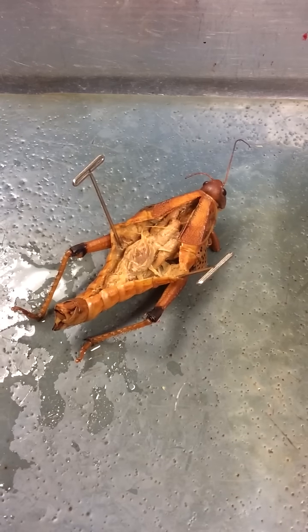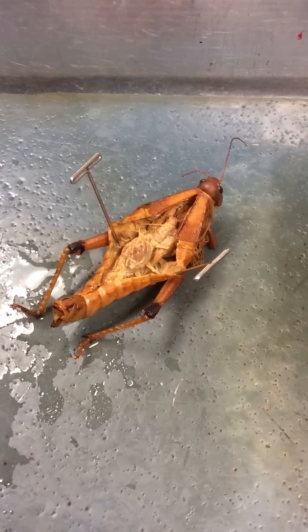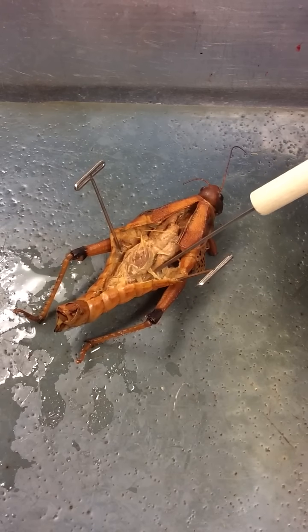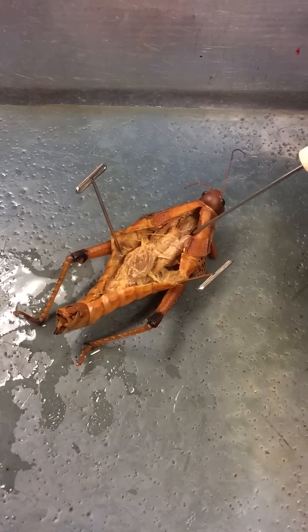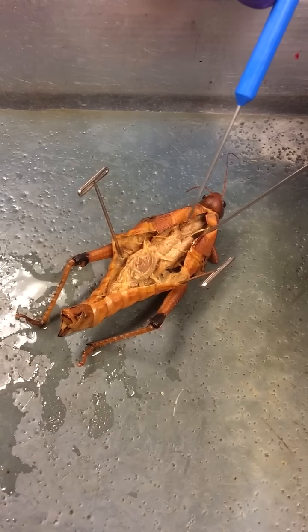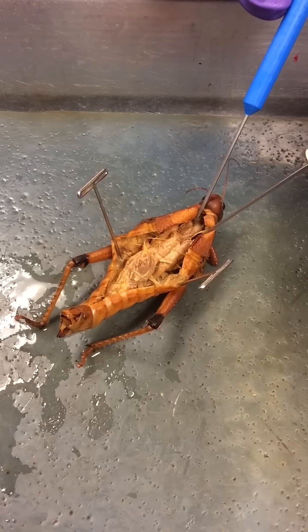Here we are with Bio 182 doing a dissection of a grasshopper. This is order Orthoptera. We'll start with internal anatomy. Here we have the trachea. If we work ourselves medially, we'll find gastric ceca. And then even more anterior, we find ourselves with a crop.